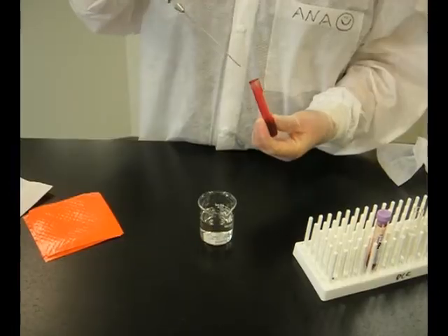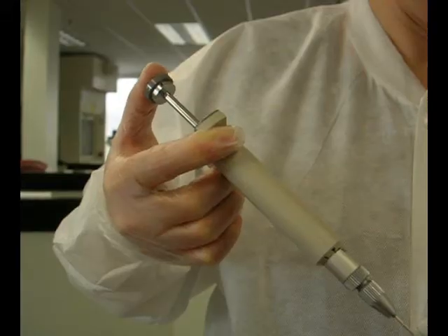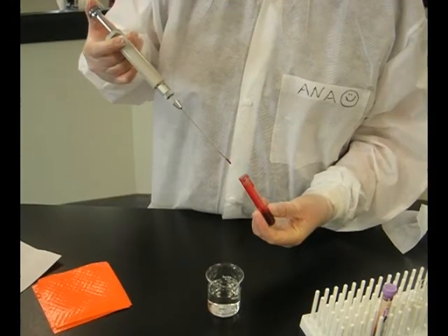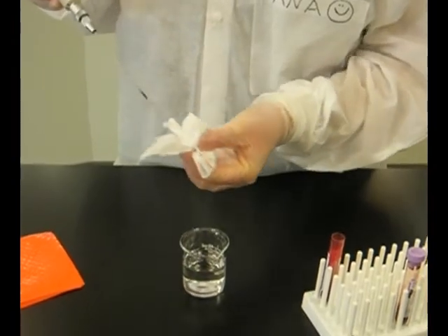Press the plunger down, insert the tip inside the blood sample, and gently release the plunger. Wipe the capillary tube being careful not to remove any sample.